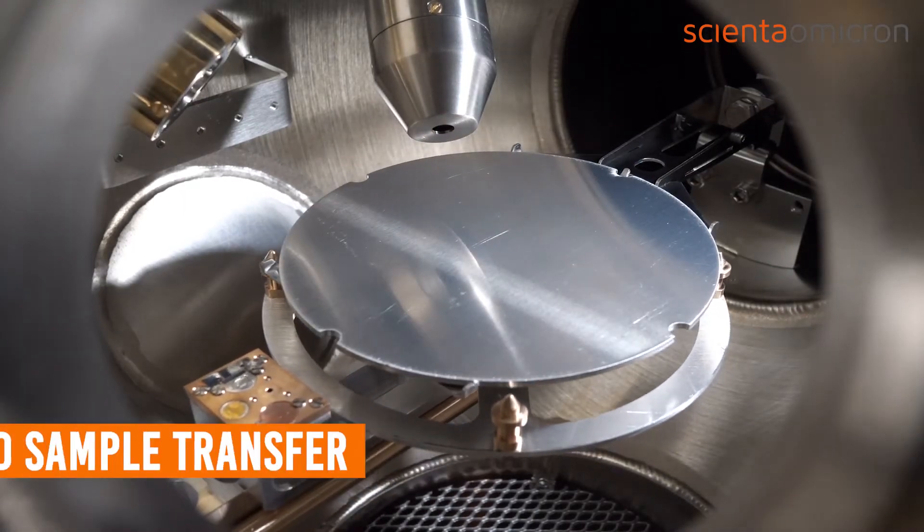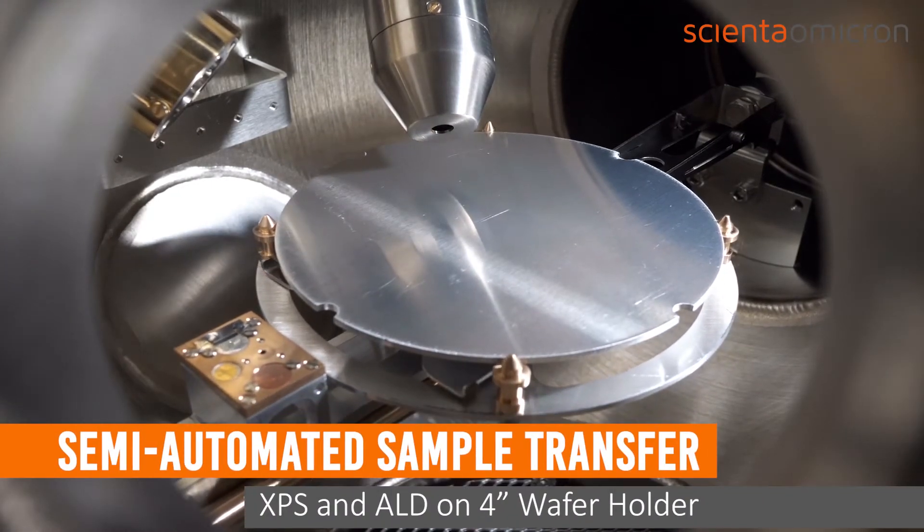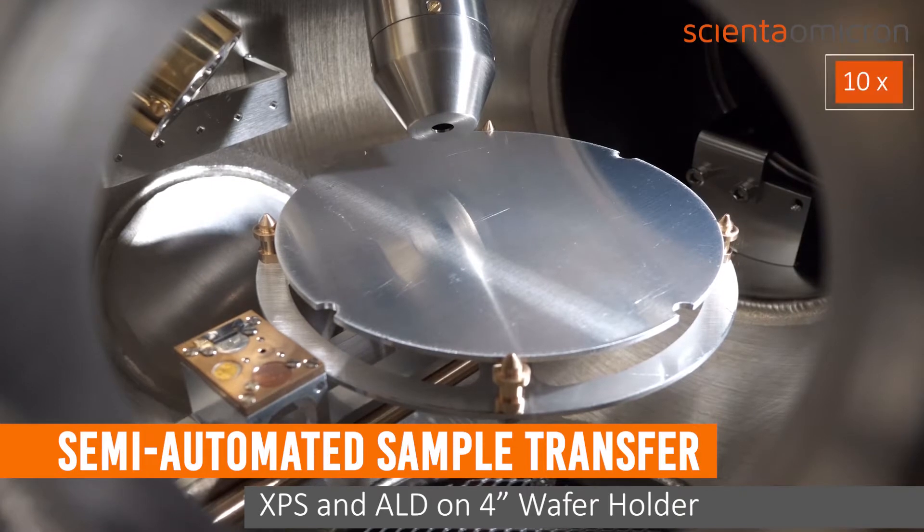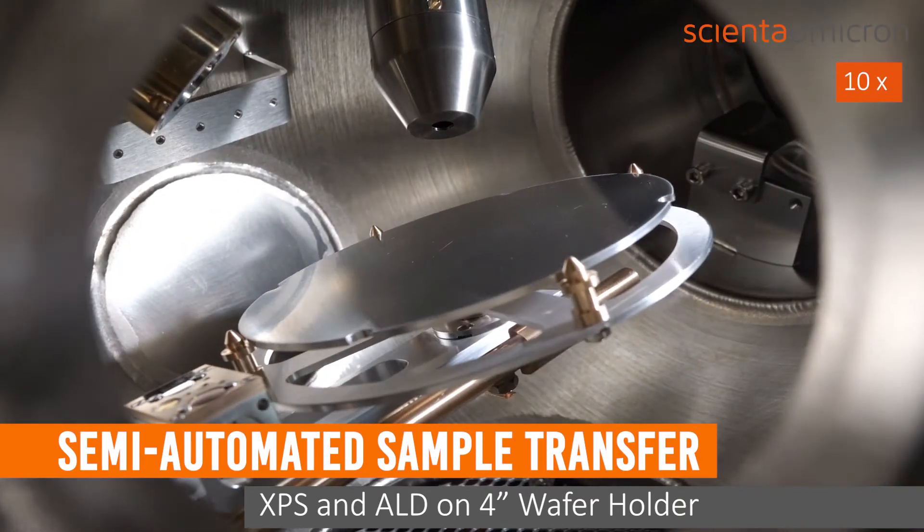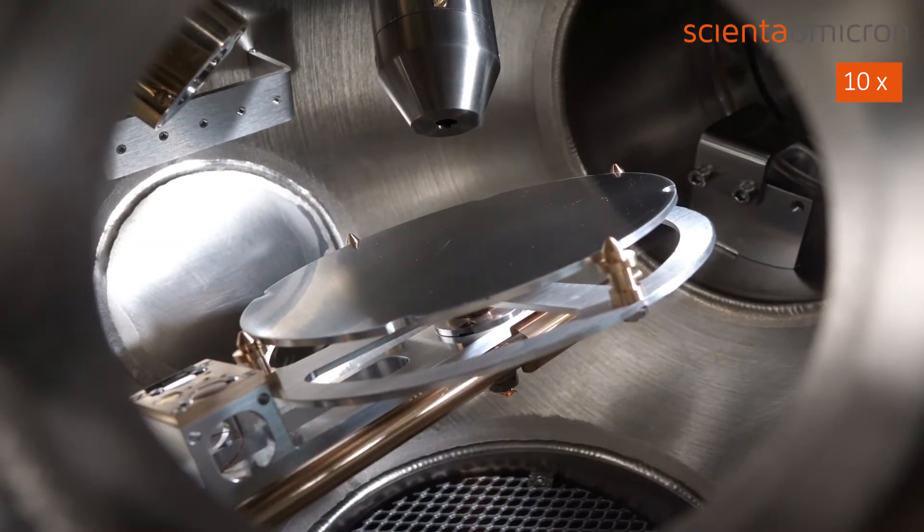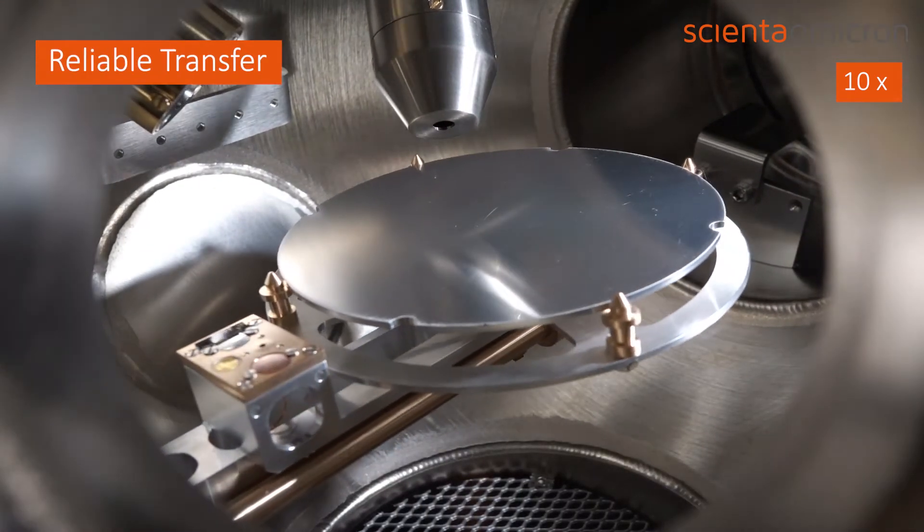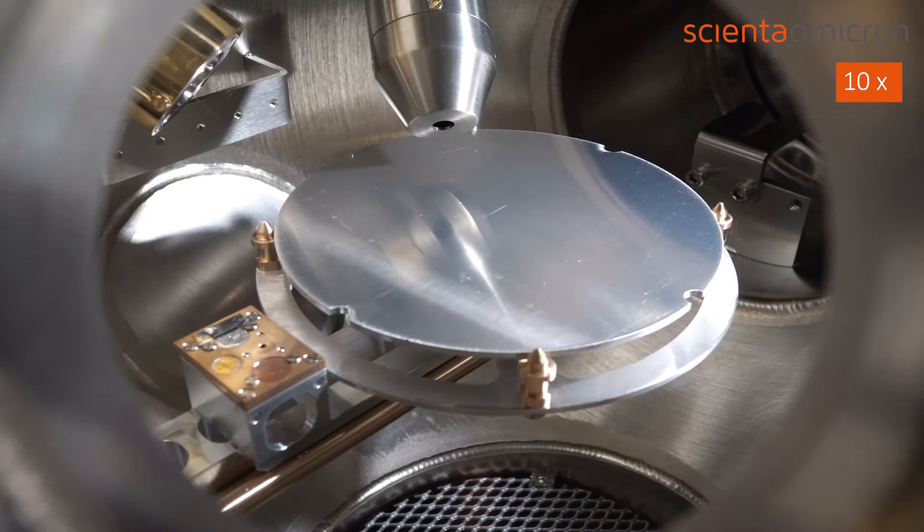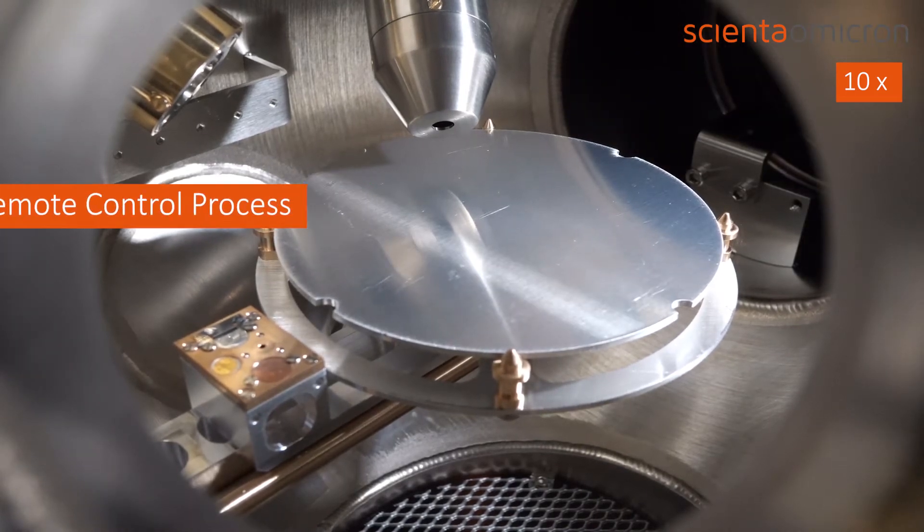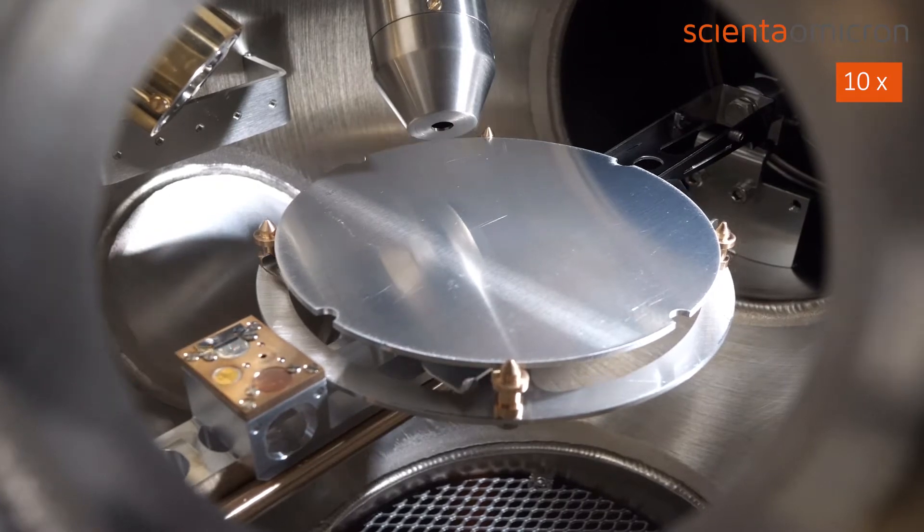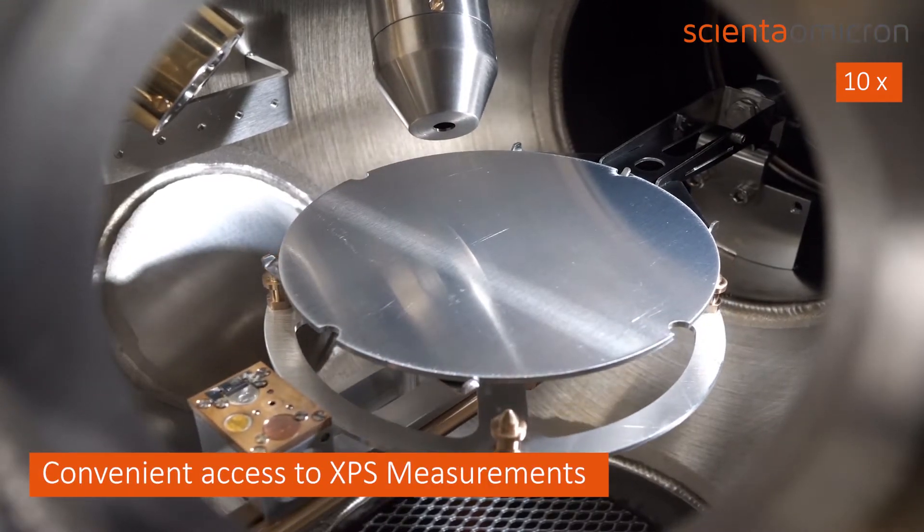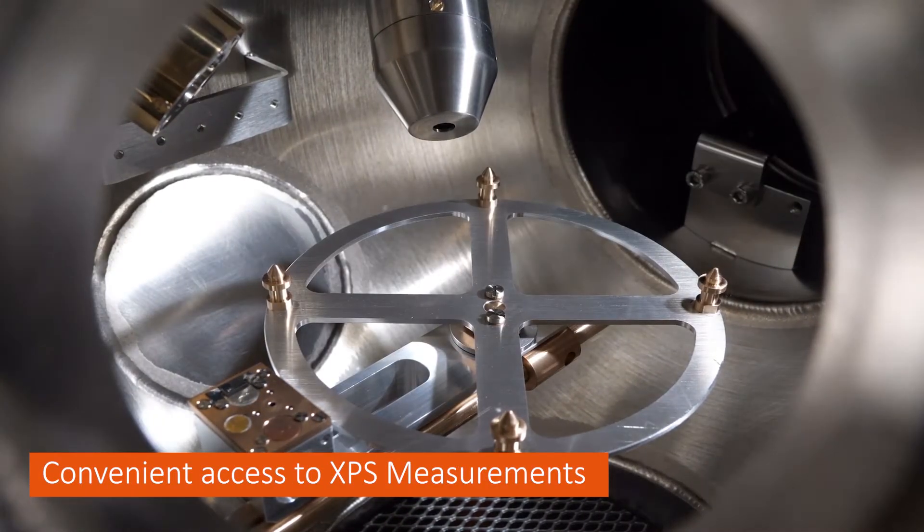This video demonstrates the semi-automated sample transfer of 4-inch wafer holders with a robotic arm. The system features highly reliable transfers with few operator interactions, a remote-controlled process interlock to secure safe operation of the cluster system, and convenient access to X-ray photoelectron spectroscopy measurements after ALD growth cycles.